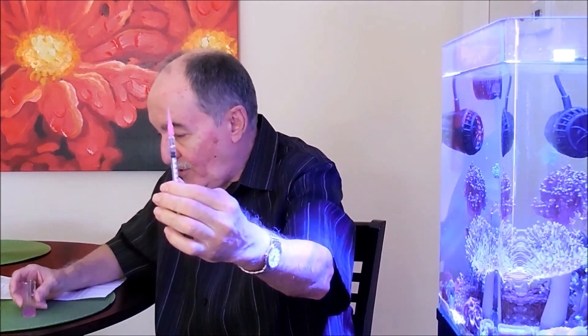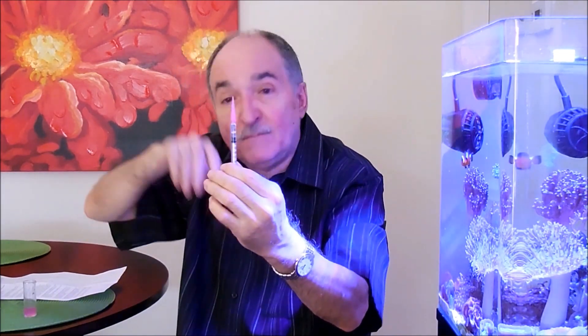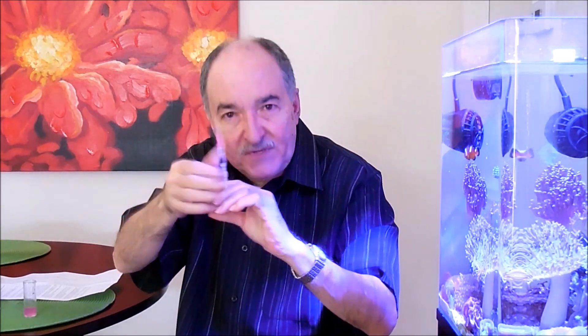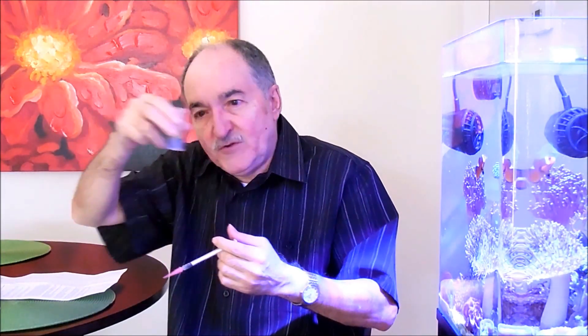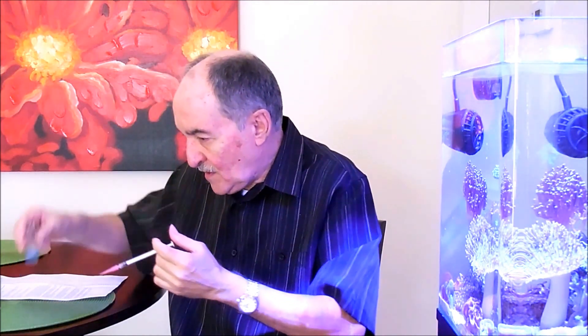You're going to notice that on the front there's a little air vacuum that's produced because of the needle before it starts to get liquid. You're going to have that discrepancy, but that's okay, that's fine, that's understood when it comes to the calibration and measurements on this test. Here's where I start to get precise. The liquid is starting to change. Let's hit one more drop. And there we are.